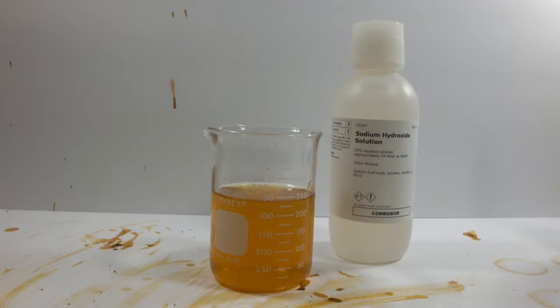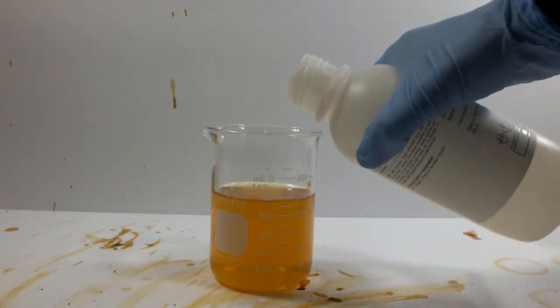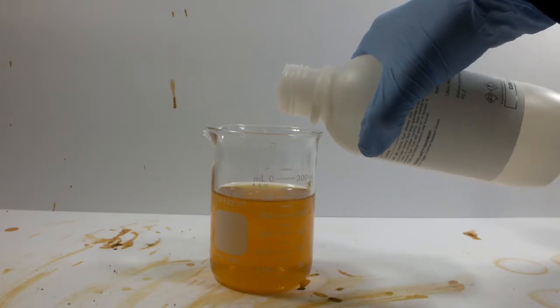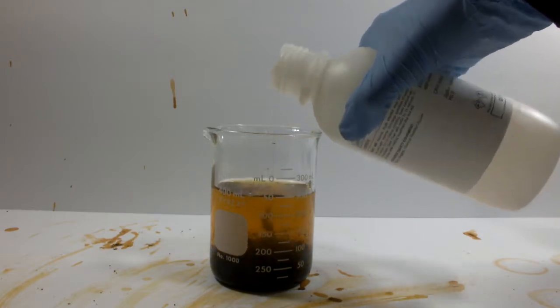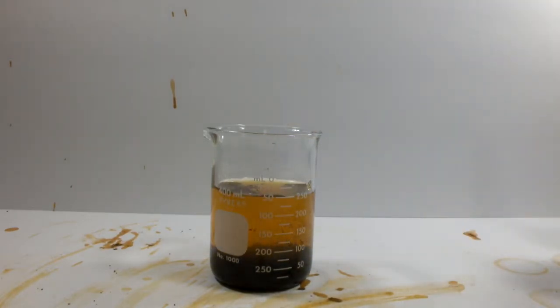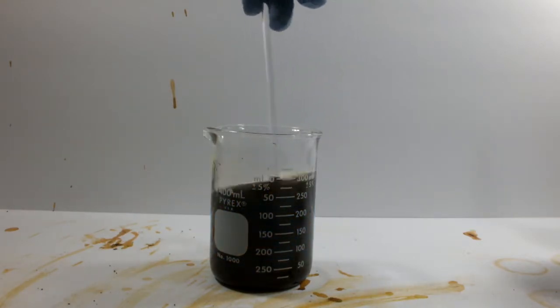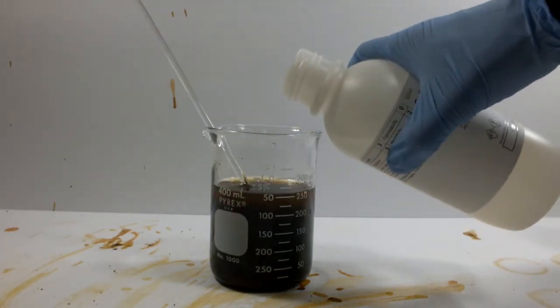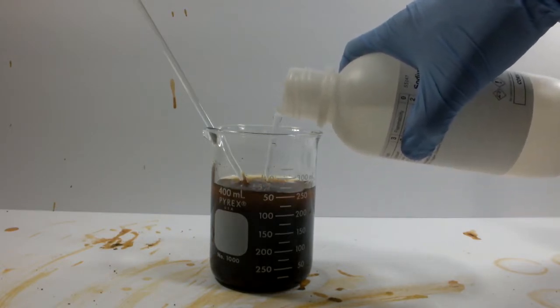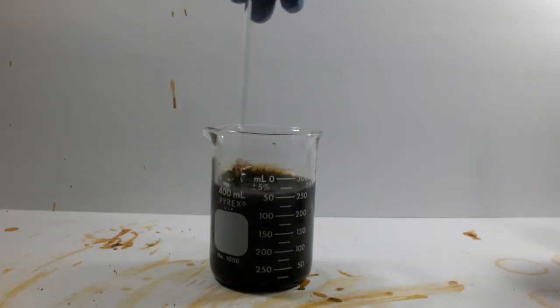I also combined the last little bit of the filtrate and the rest of the iron oxide washings into this beaker. The whole purpose of getting the iron 2 chloride in the first place was to make magnetite for ferrofluid. I've decided to use some sodium hydroxide to see if I could precipitate something like magnetite. A specific ratio of iron 2 to iron 3 is necessary, and ammonium hydroxide is usually preferred if the desired outcome is ferrofluid. I have no idea what the ratio is. Basically, I just wanted to get rid of this last bit of waste somewhat creatively and in such a way that I could do some math to see how much of the iron was really recovered.